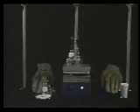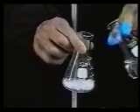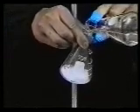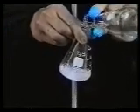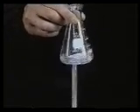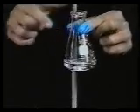Heat the solvent, and once it's at its boiling point, remove it from the heat. Add enough hot solvent to obtain a loose slurry. Swirl the flask to dissolve the solid and place this Erlenmeyer flask on the hot plate.